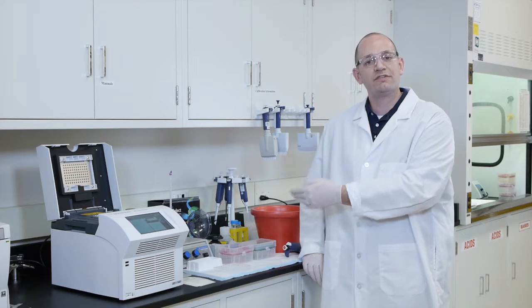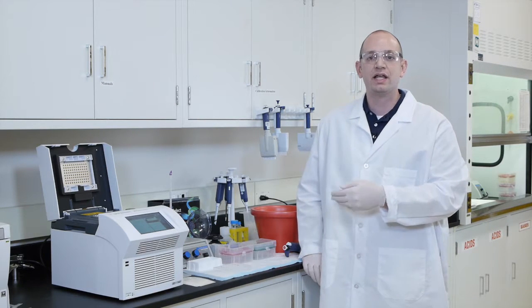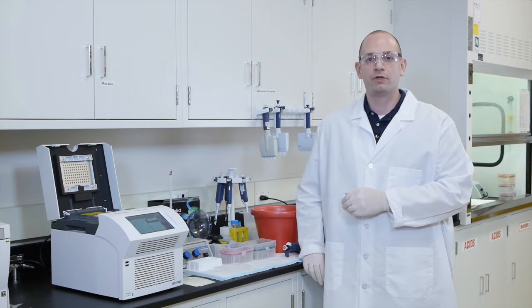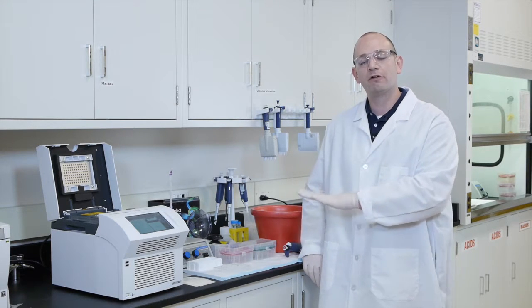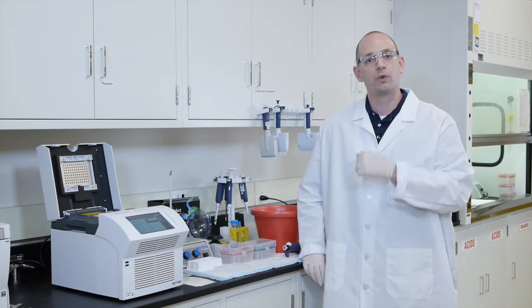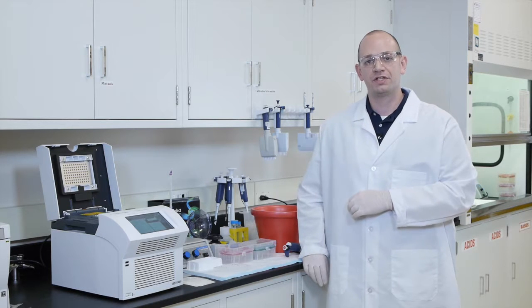Because if the hybridization buffer is left on the bench top, there's a chance that the hybridization buffer will precipitate and you'll get very poor capture performance if you use this buffer that's precipitated. So by keeping your hybridization buffer on the 37-degree heat block right up until you use it, you'll ensure that everything is in solution and ready to go for the hybridization.